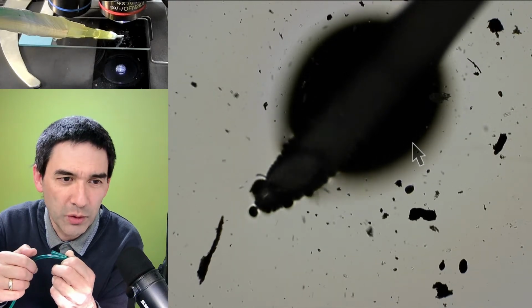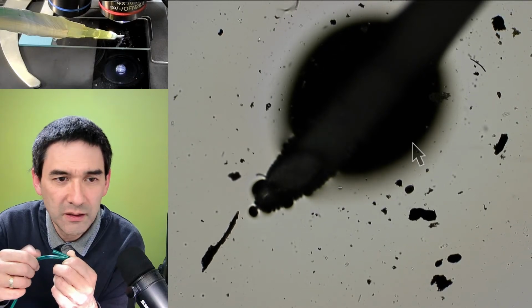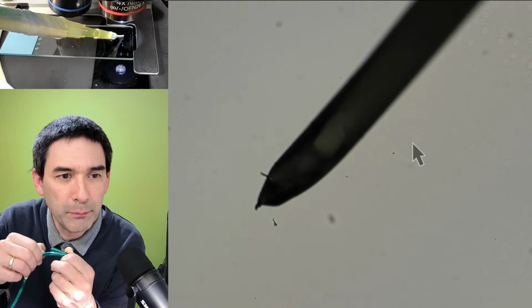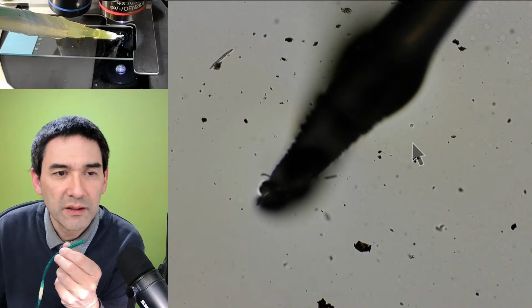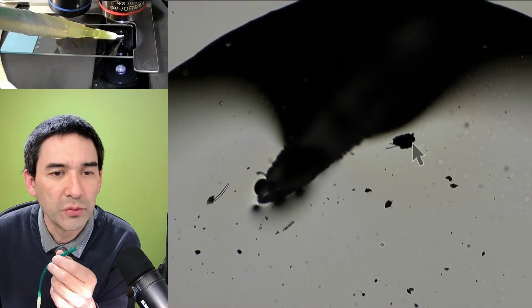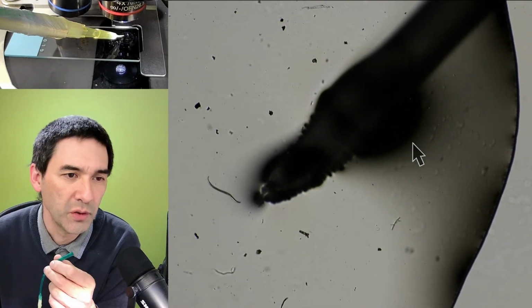Actually, now it does work. Before it didn't work. Maybe it was not quite airtight. Okay, so that's actually also a possibility. You move it over, and then that's over here. I try to release it again. I push it again. Here we go, and then you have to release it. So that is the thing here. I was able to release it again. You see over here there are not many. There's this worm here that I got.